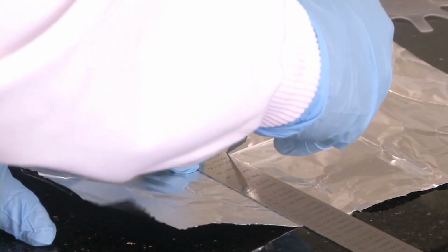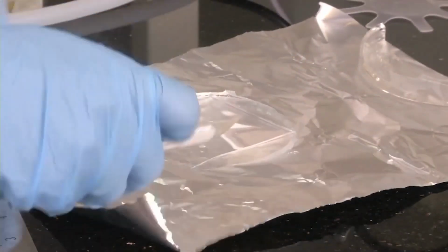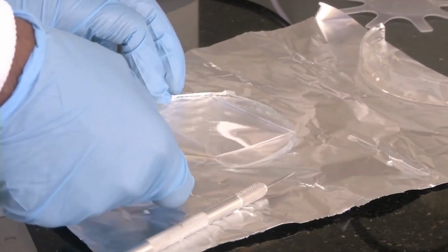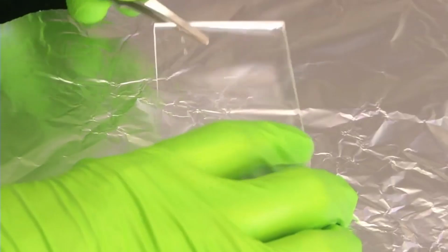So now we have made all 4 directions. With a metal scale we have cut. Now we will remove the extra material around that square rectangular portion. Yes, that is removed. Now we have peeled off the extra PDMS membrane and made a rectangular portion for our device.